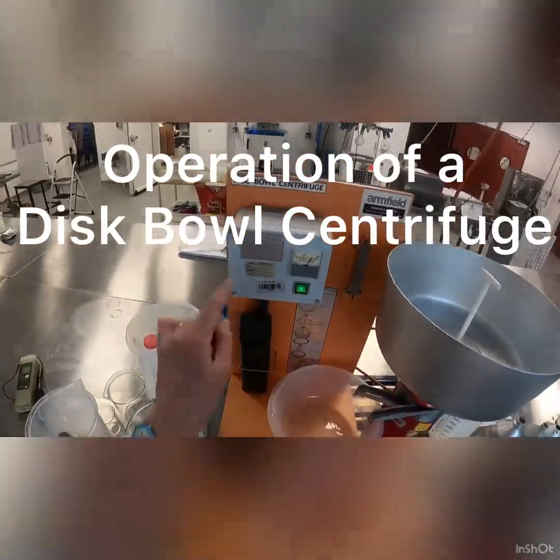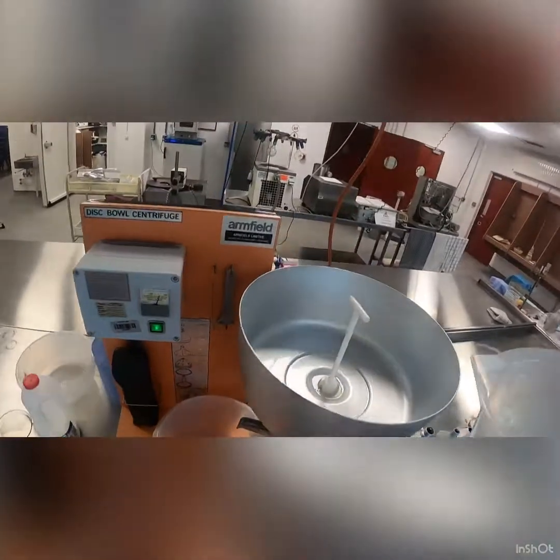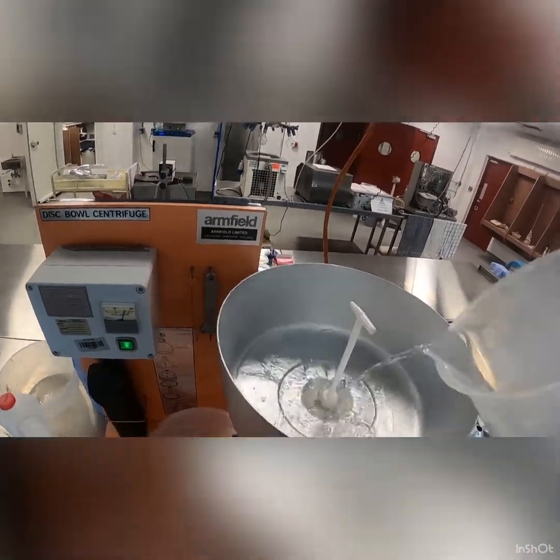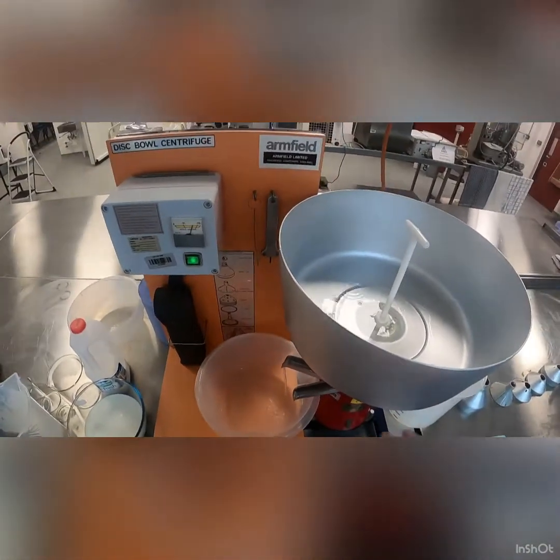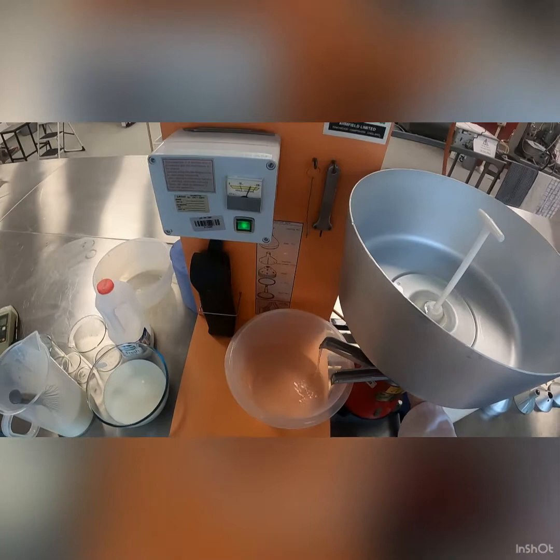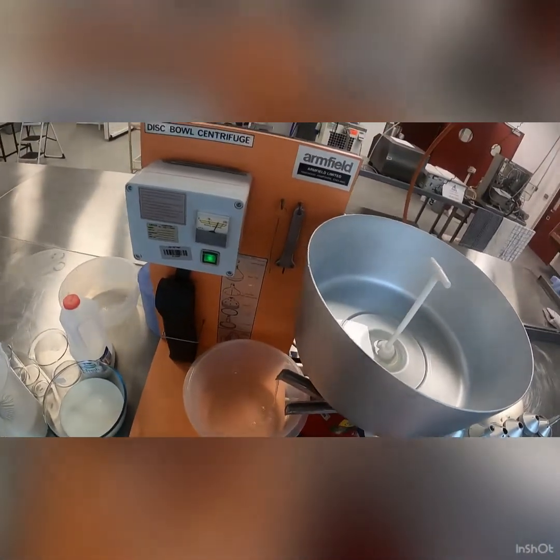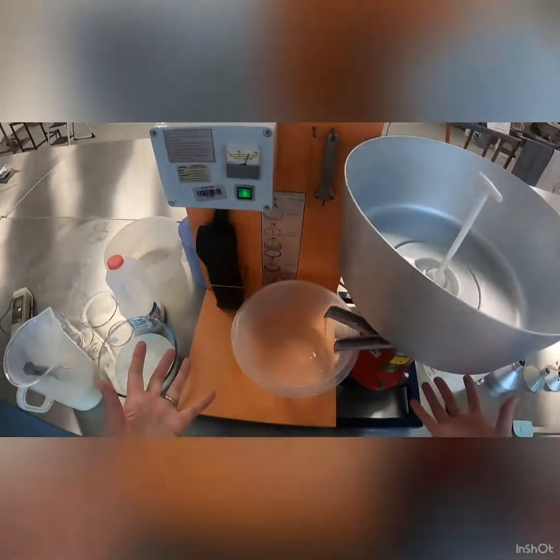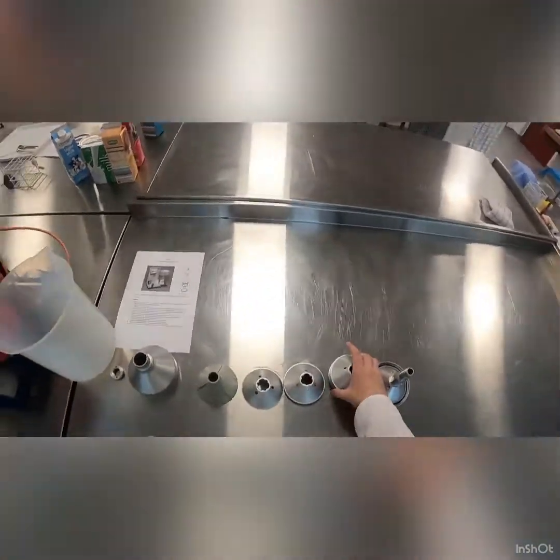What we have here is a disc bowl centrifuge, and what we're going to do is run some milk through it so it separates the samples out into a heavier portion and a lighter portion. Like any machine, it needs to be heated up beforehand, so all I'm doing is running some hot water through the machine. You can hear that it's making a high-pitched noise, like a helicopter.